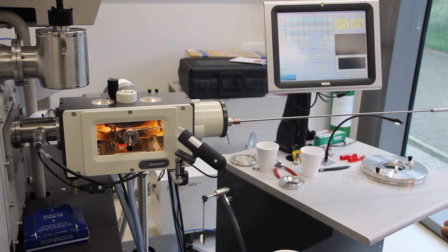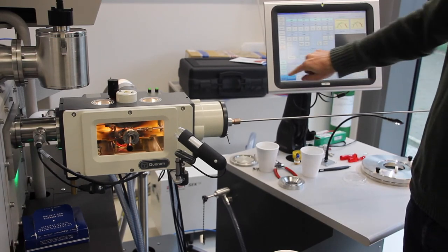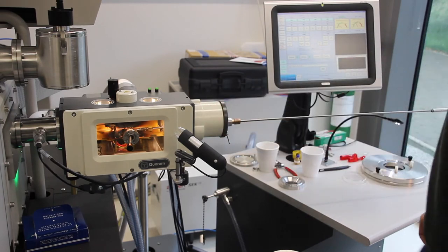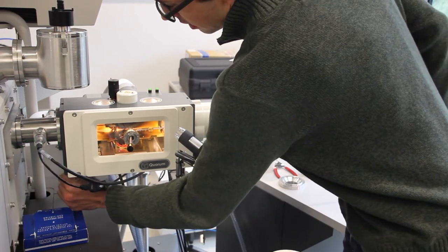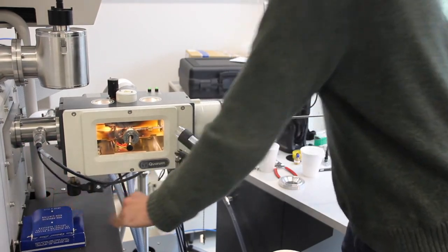You've now made your beautiful lamella and it's time to take the grid out. We're going to start by hitting the transfer button, and we will now open the last valve that we closed, the transfer valve, clockwise and down.